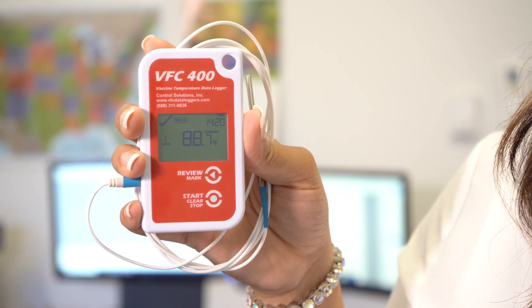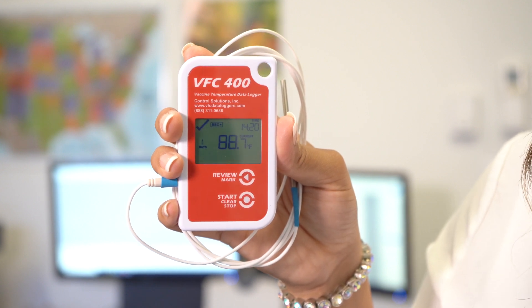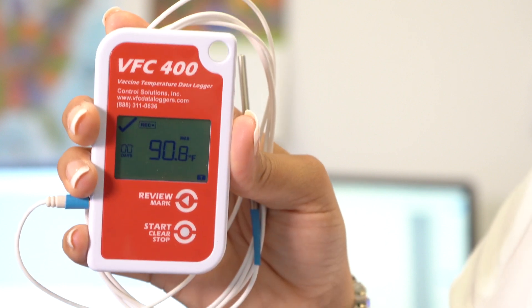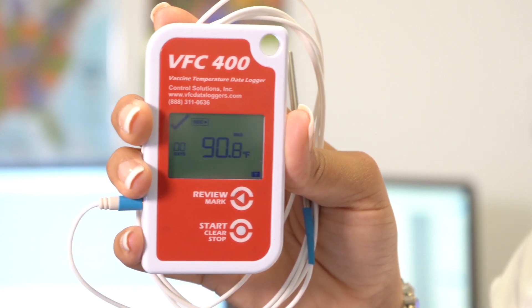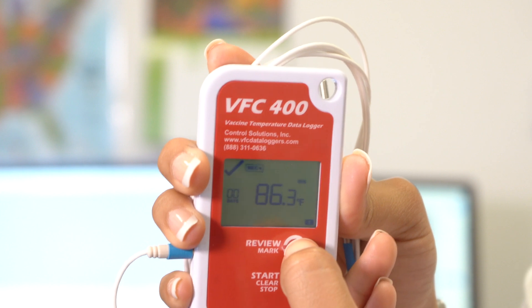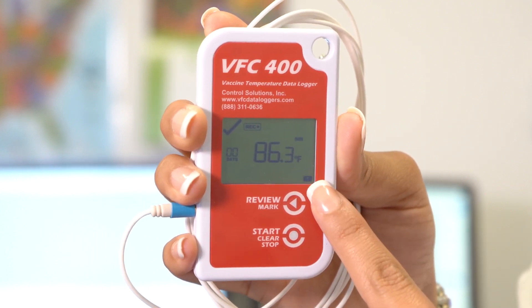To review your maximum and minimum temperatures, simply press down on the review mark button. When you hold it down the first time, that will show you your maximum temperature — you will see T flashing for today. When you press it a second time, it will show you your minimum temperature, also with a T flashing for today. To review previous max and mins, continue pressing the review mark button. The max and min temperatures will reset themselves every night at midnight.